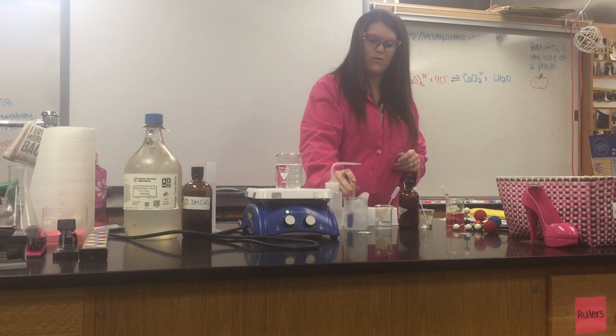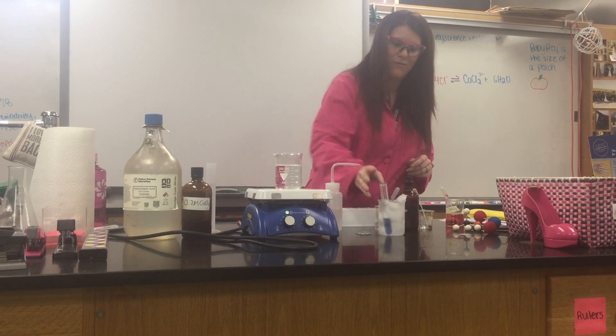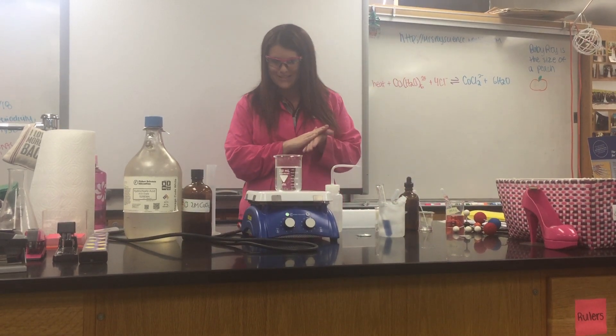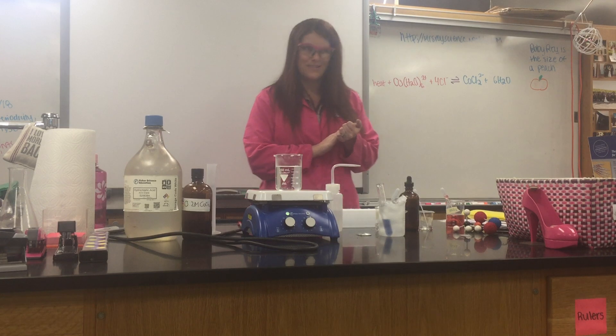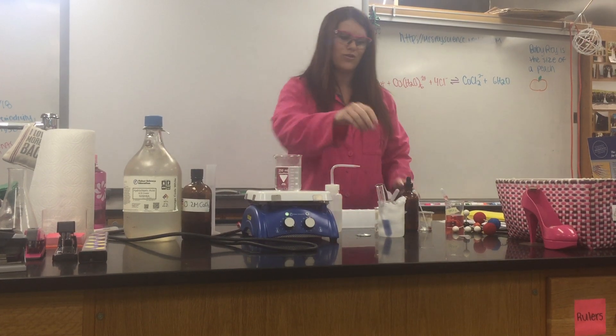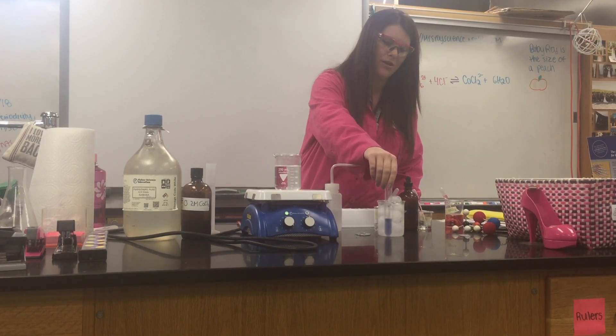We are going to add cold water — so we're removing heat from the reaction. This is probably going to take a few minutes. It's an endothermic reaction, so we usually put heat in to shift it towards the products.